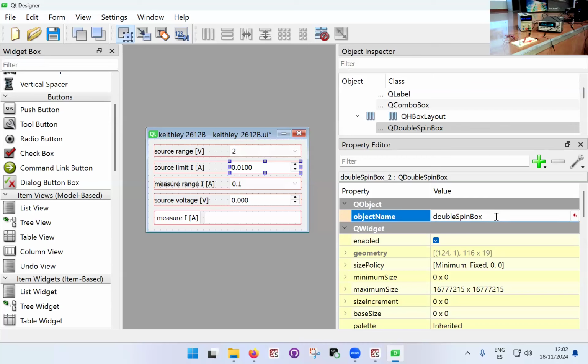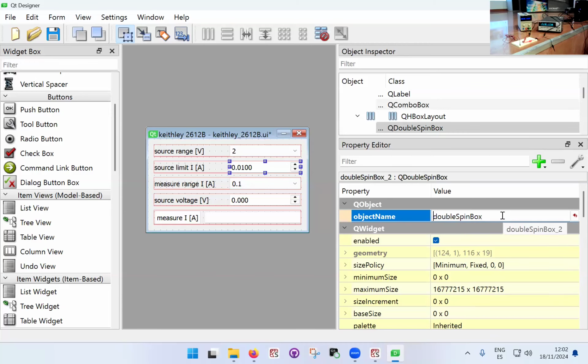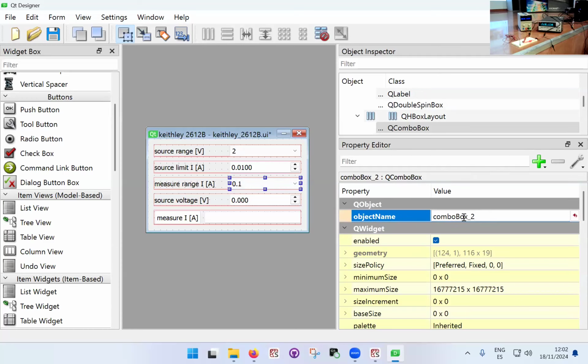I could remove this combo box piece of text, but I personally find it quite useful to leave, so you know in the code that you're referring to a user interface object. So I'm going to leave that there, and I'm going to leave the double spin box as well. That's why a big screen is quite convenient when you're programming in this way, because you can afford to have longer variable names, and it doesn't completely saturate your screen, and you can have multiple things visualized at once. So source limit, I'm going to call that source limit double spin box, measure range combo box.